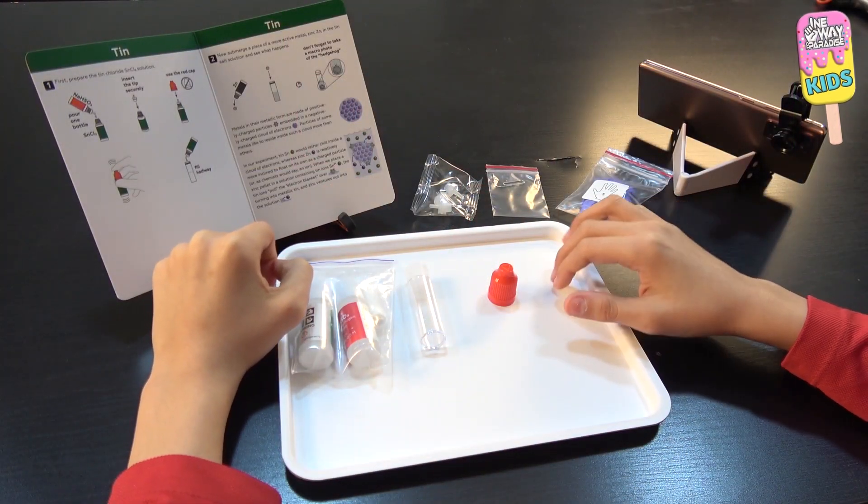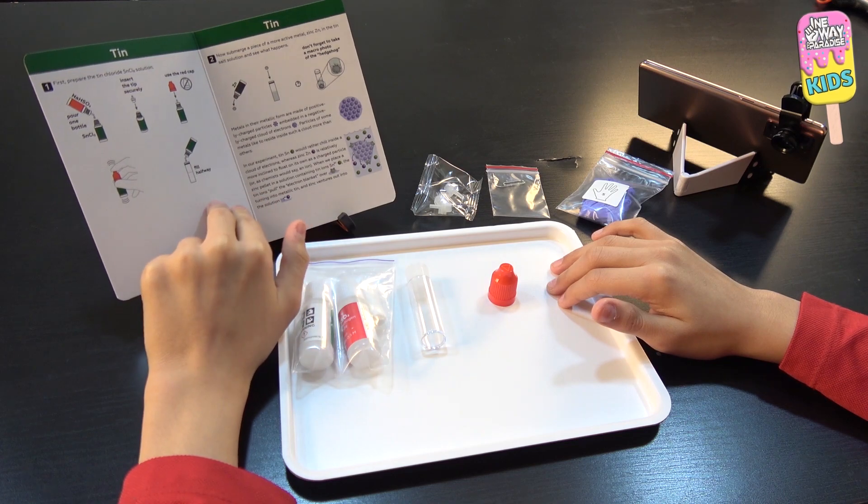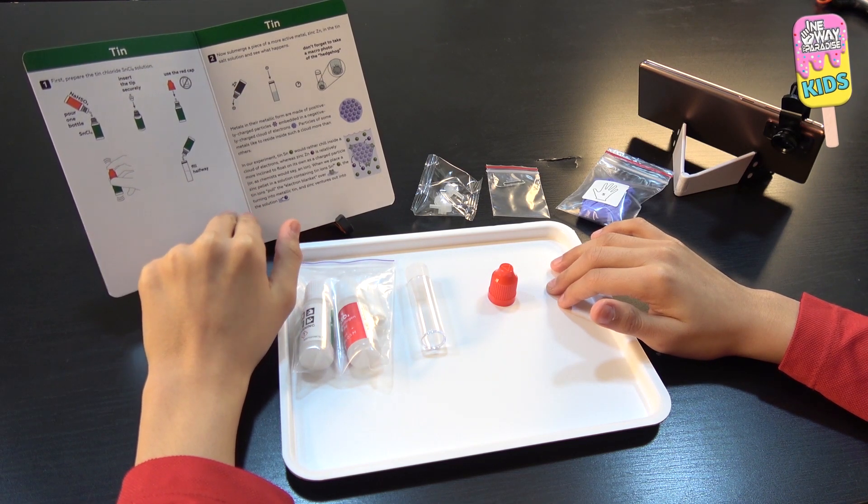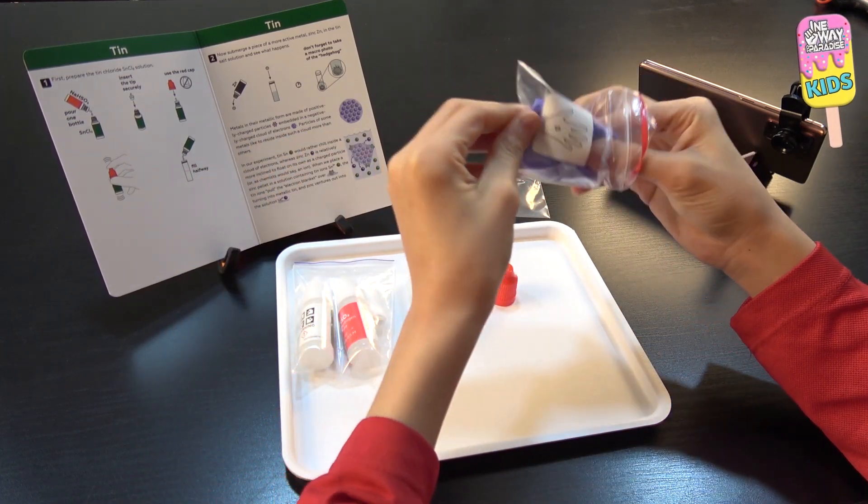So these are the materials that we'll need for the tin hedgehog experiment and I have the instructions which are inside of the pamphlet over here. But first, I'm already wearing the goggles. I'm going to put on the gloves.